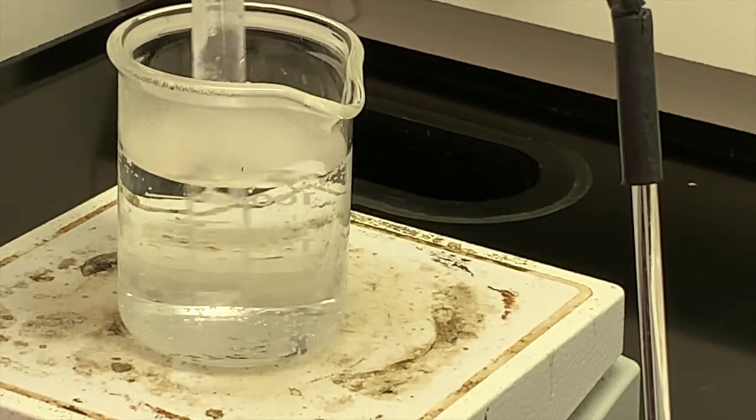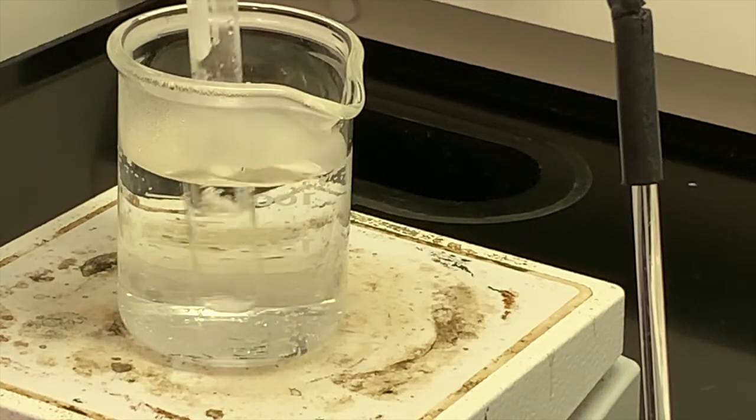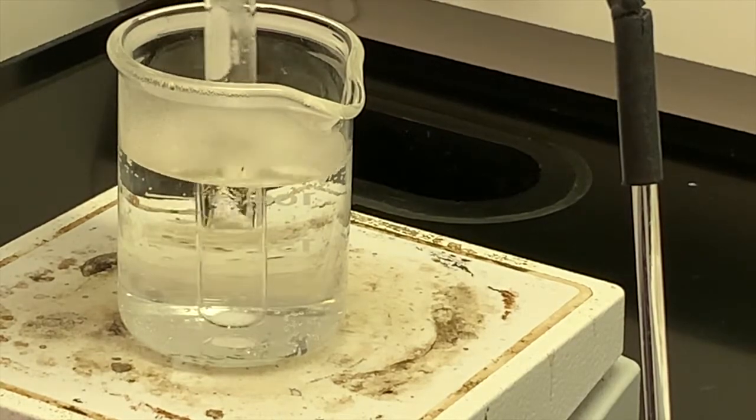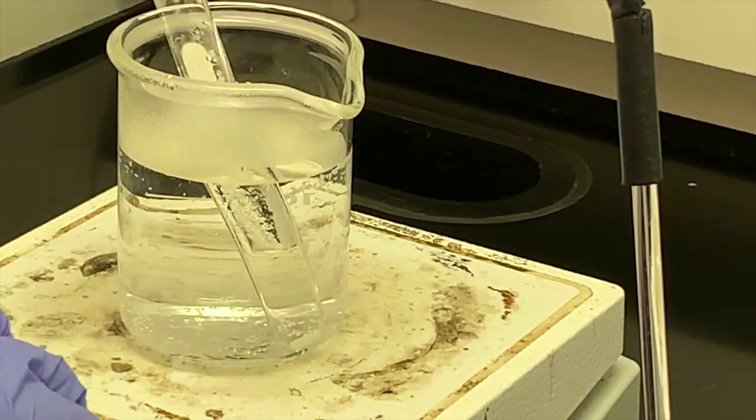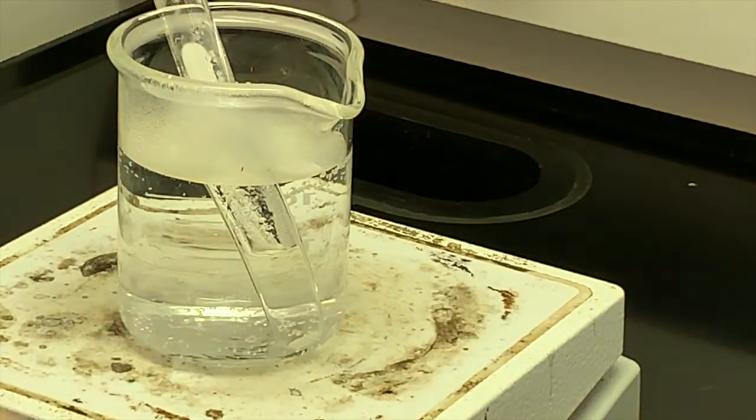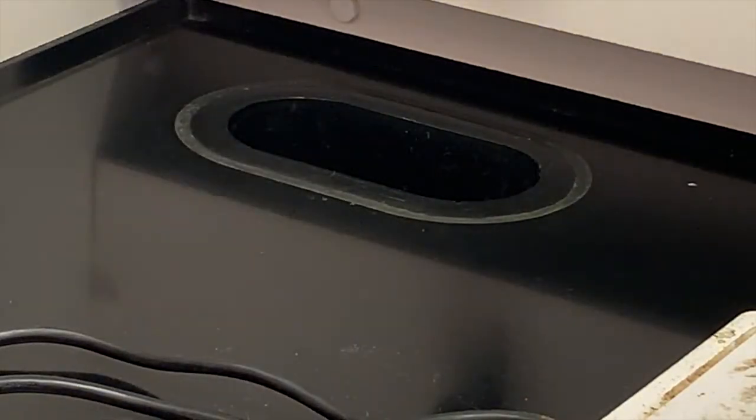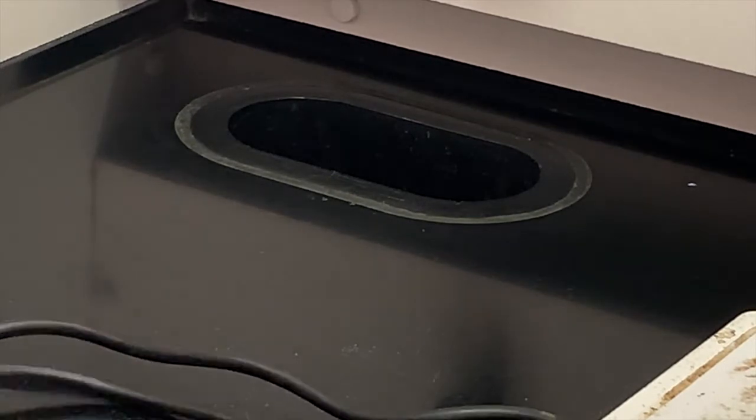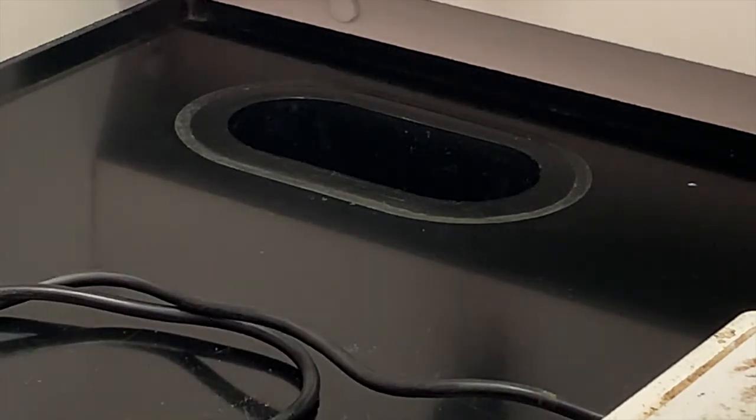Okay, so I think that you get the idea of what's happening inside this test tube when we put it in the hot water. I'm not going to wait any longer before moving on to the next part of the experiment. I'm just going to set that aside and we'll look at that in a few minutes again to see if all of that solid does dissolve.